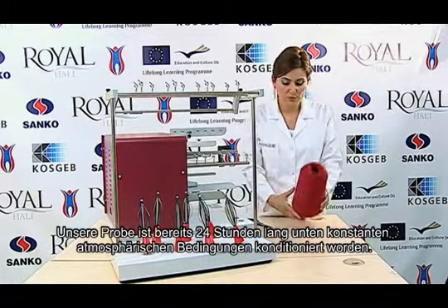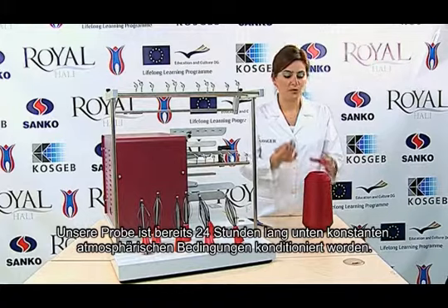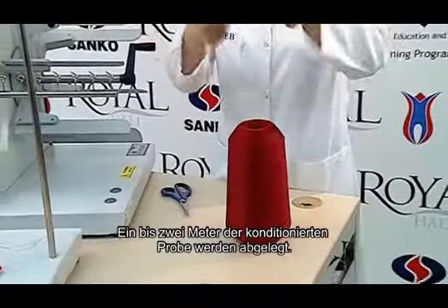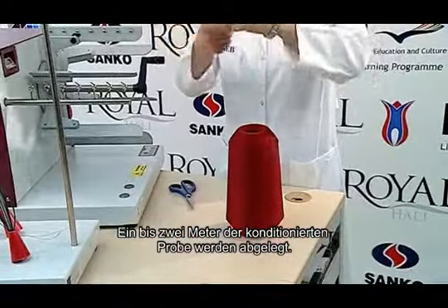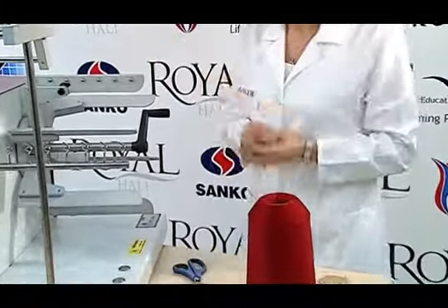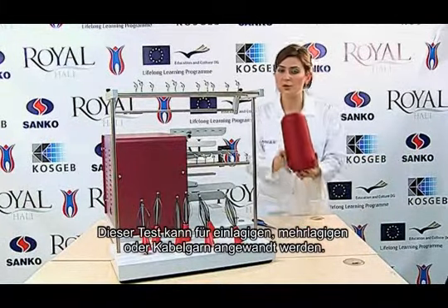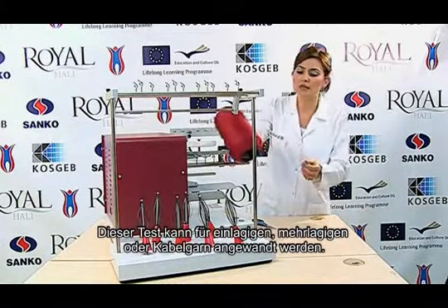Our sample has already been conditioned at stable atmospheric conditions for 24 hours. 1 to 2 meters of the conditioned test sample are discarded. This test can be applied to single-ply, multi-ply and cable yarns.